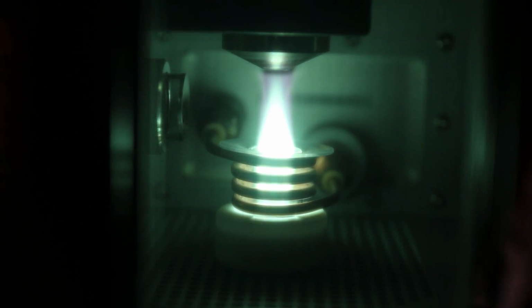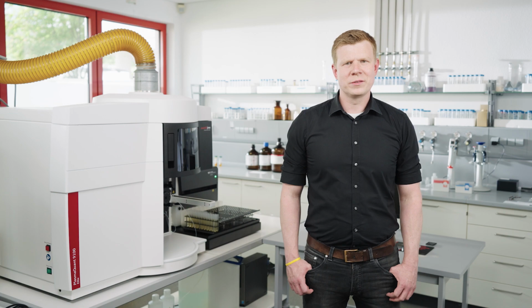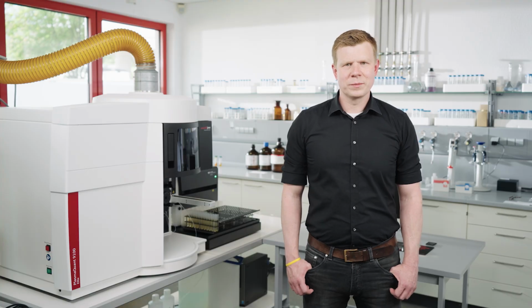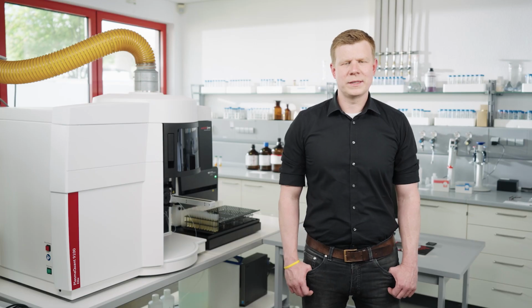A very common source of errors are leakages in the sample introduction system, originating from worn tubing, loose connectors, or back pressure in the system. Therefore, it's recommended to inspect and change the pump tubing material on a regular basis. Back pressure in the system can occur if the nebulizer is clogged or if an insufficiently small nebulizer is used. If this error occurs frequently, change the nebulizer type or adapt the pump rate and the nebulizer gas flow.